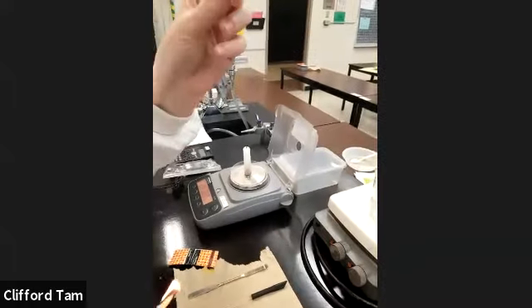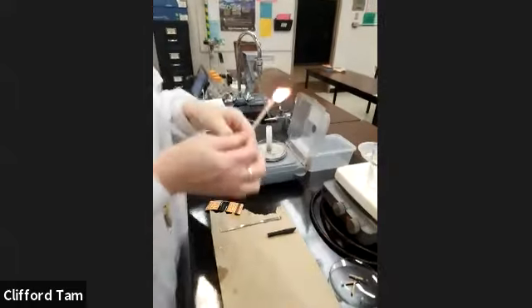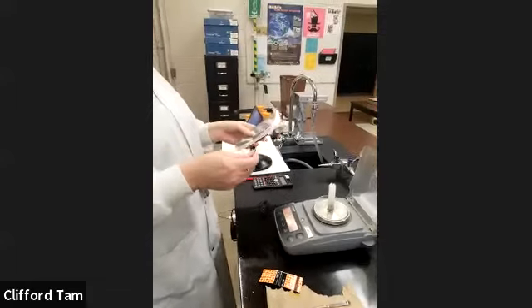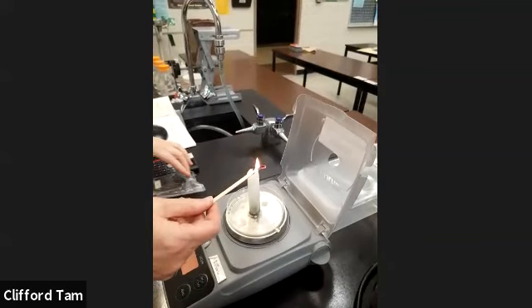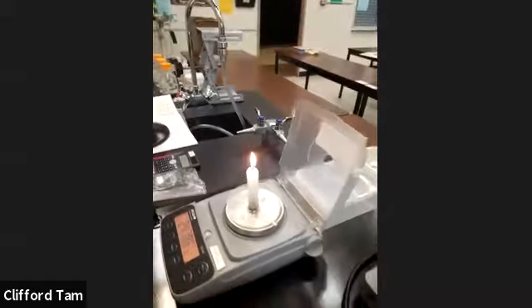And what's going to happen is, oh, she's lighting up the match here. I'm trying to blow it out. Yes. Okay. So what she's going to do is, at the same time as she lights it, she's going to turn on the stopwatch. And basically every 30 seconds, was it, Xantha? Yes. We take the mass.